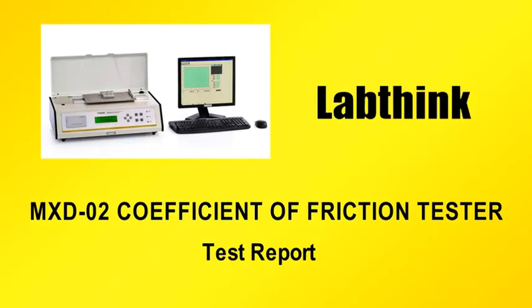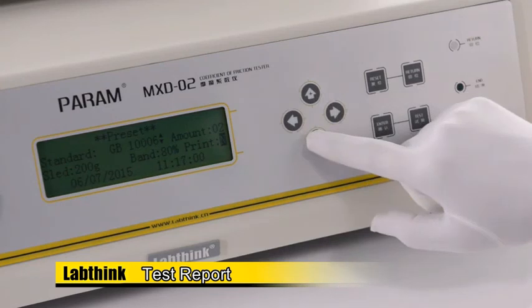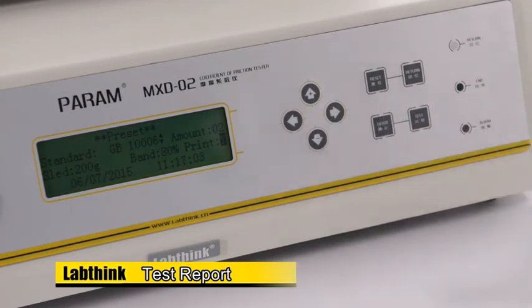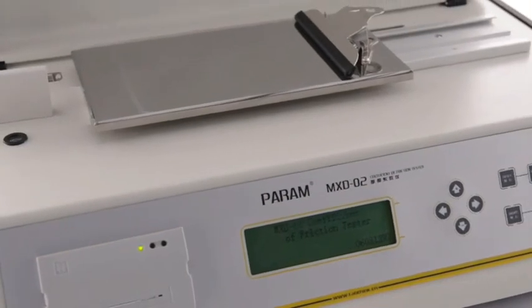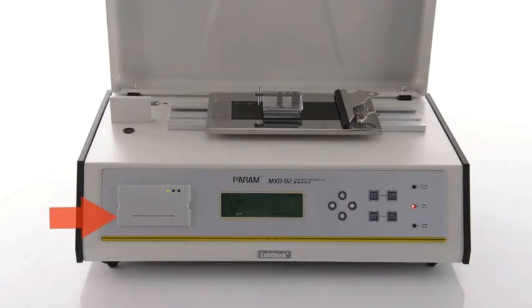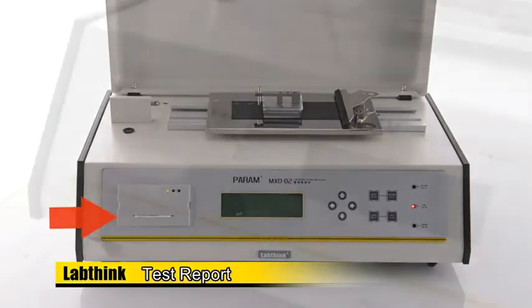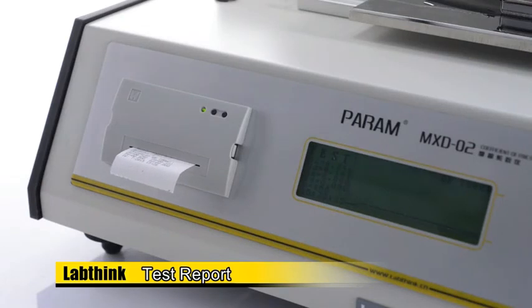Test Report. Select Yes for the print option in the preset interface and press Enter to save the setting. The indicator light for the microprinter will be turned on. When the preset amount of test specimens is reached, the microprinter will print the test report by pressing the test key.